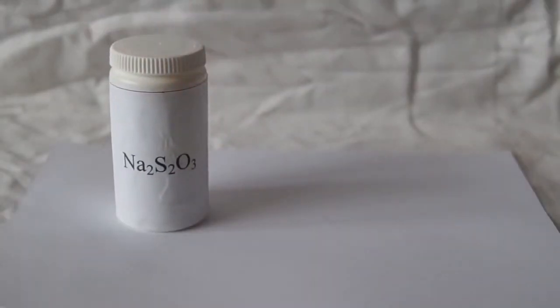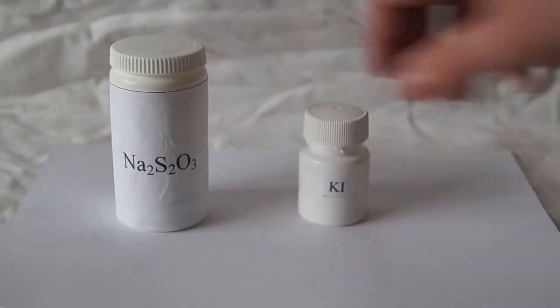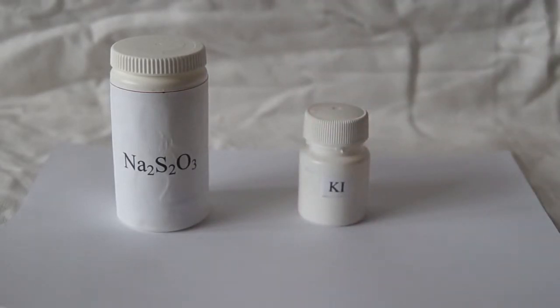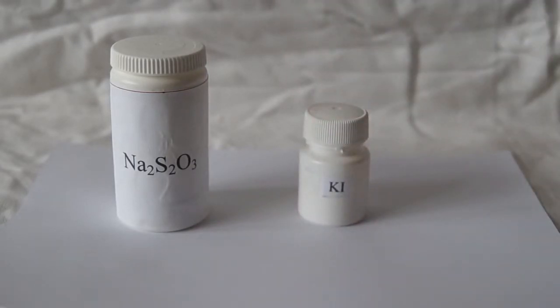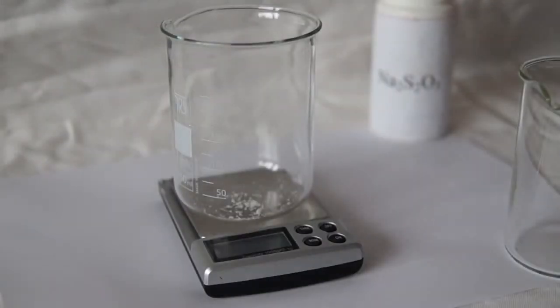Hello everyone! Today we'll have a very unusual chemical reaction called Egyptian night, or the simplified version of the chemical pendulum.